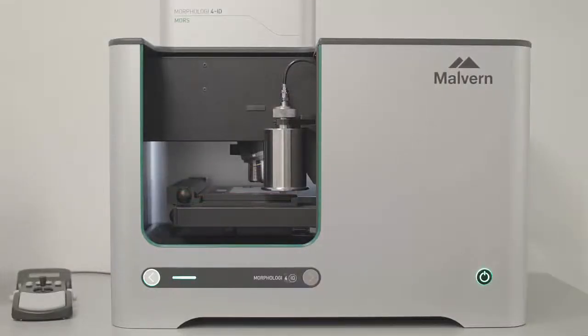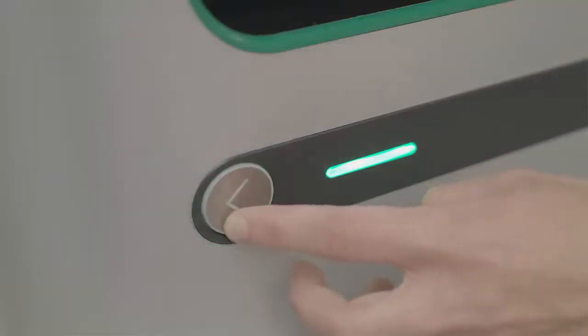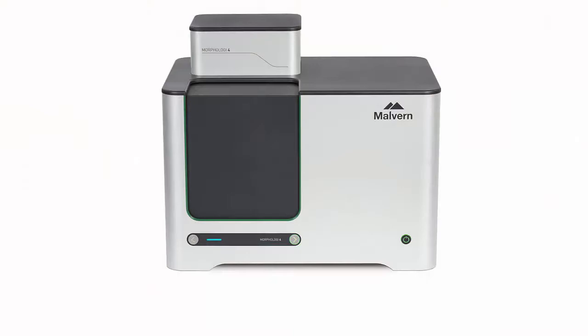Automated image analysis using the Morphologi 4 provides high-quality images of metal powders, resulting in particle shape parameters and statistics which can differentiate subtle but significant differences between samples, enabling the quality of metal powders to be objectively assessed, reducing defects in finished parts, ensuring consistent part manufacture, enabling more material to be recycled, and reducing waste.